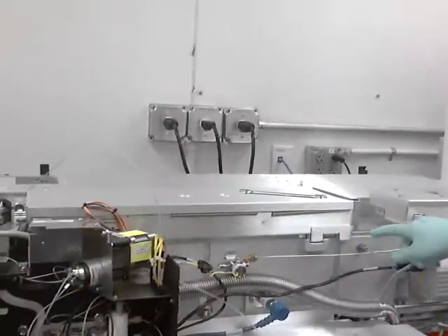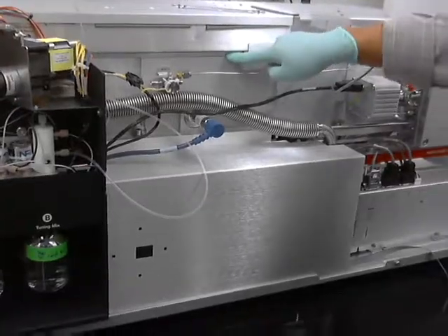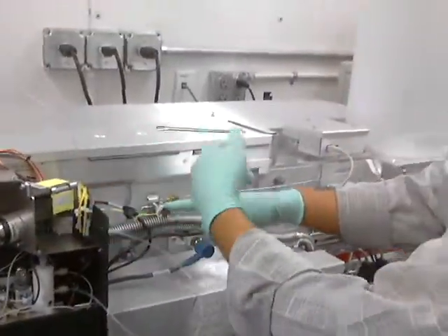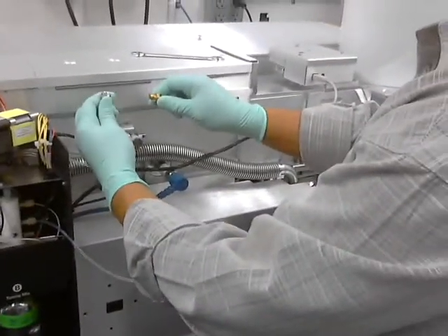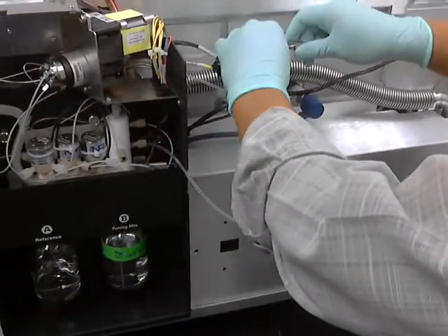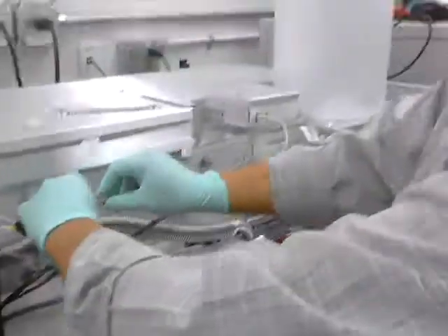One thing you know it's ready — you can see how it's separated — and then I just shut it off. So when you shut it off, this vent valve will shut off also, so no more nitrogen coming in. What I like to do is put a union, and this union will allow nitrogen to flood the instrument all the time — you circumvent the valve.